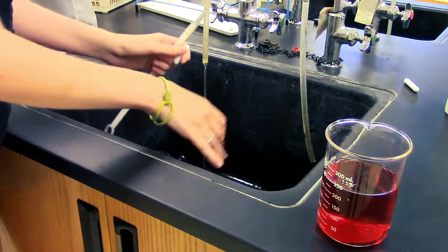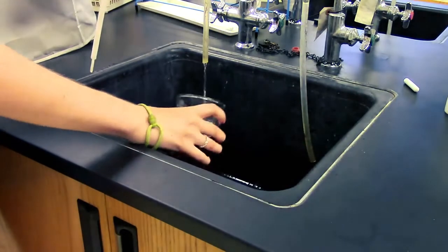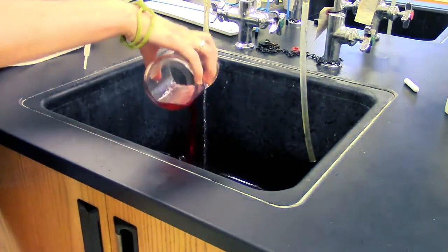Clean the stir bar like you would any other piece of lab equipment. Now your solution is well mixed and you can use it however you need.